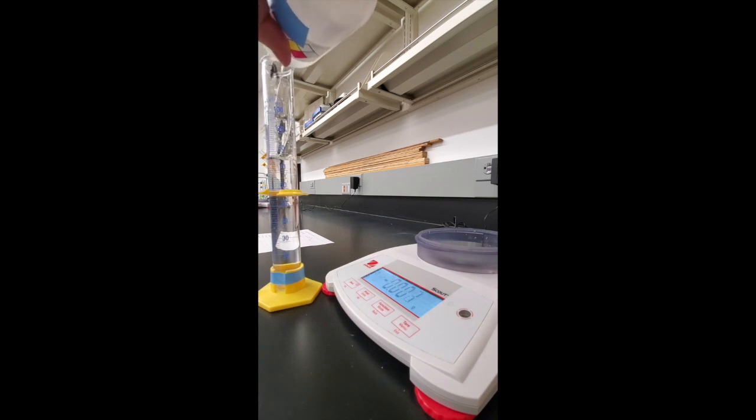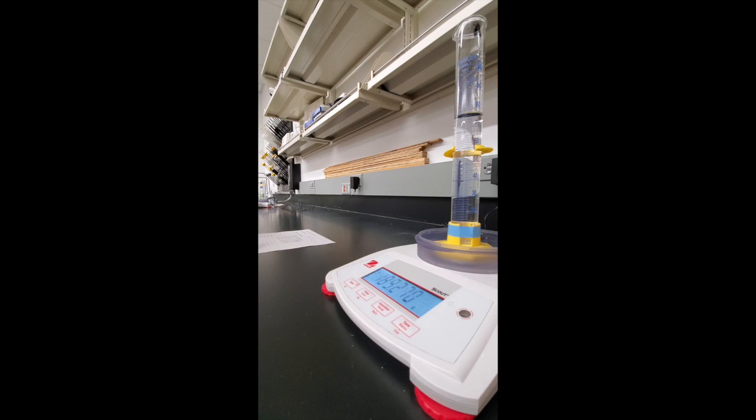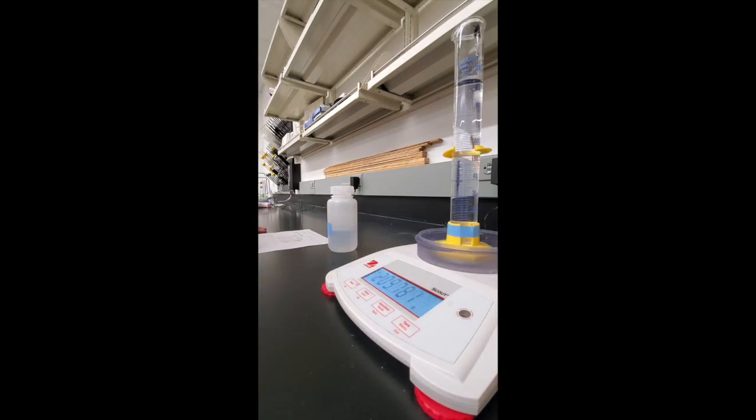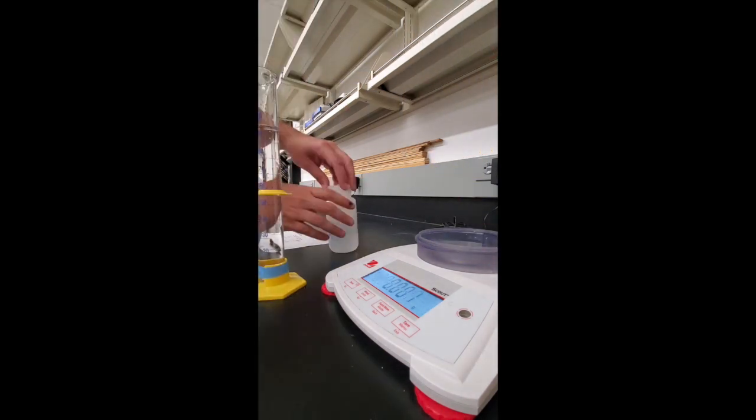The fourth measurement takes us up to a volume of 78 milliliters and the mass is 189.270 grams. The last addition of solution B takes us up to a mass of 209.781 grams and 97.0 milliliters.